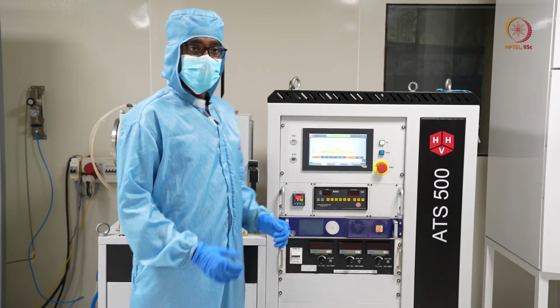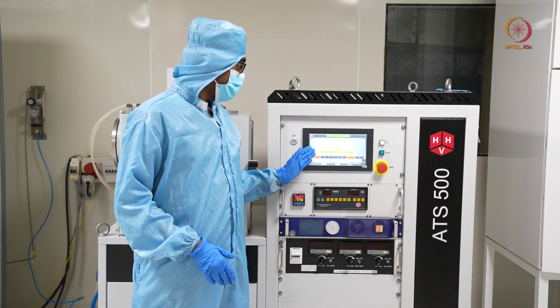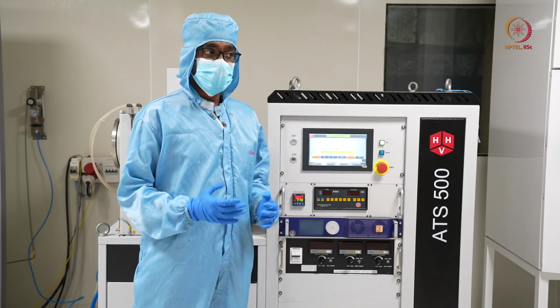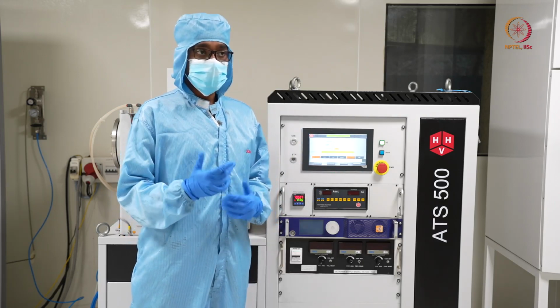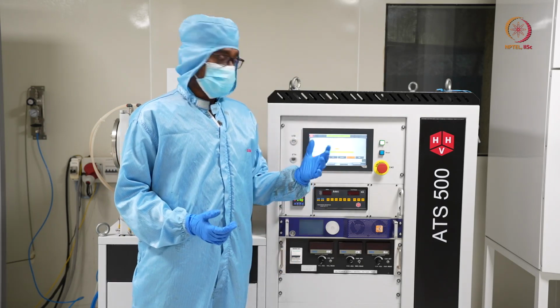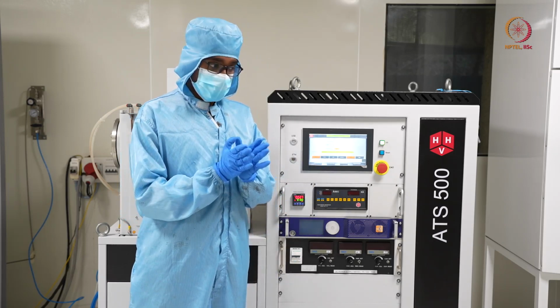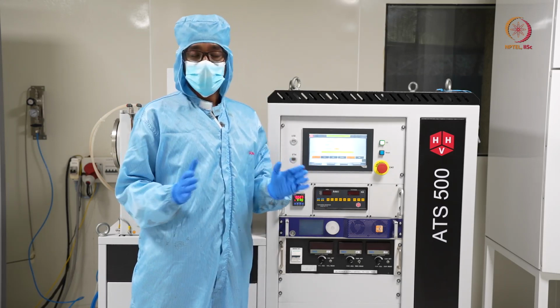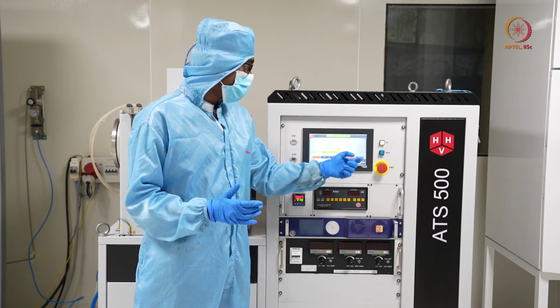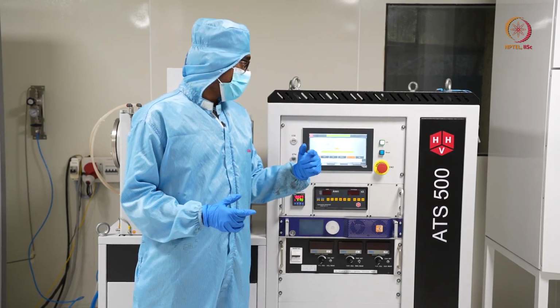So we have waited for almost 20 minutes. After 7 to 8 minutes only it will be standby. You can see here the status as standby, but we have to wait for some more time, so that the speed or the RPM of the blades in our pump is completely stopped, or almost stopped. Then the sudden switching off will not affect the supply or the blades.